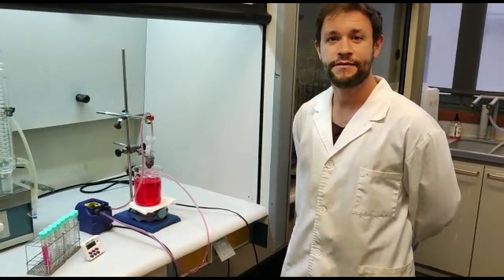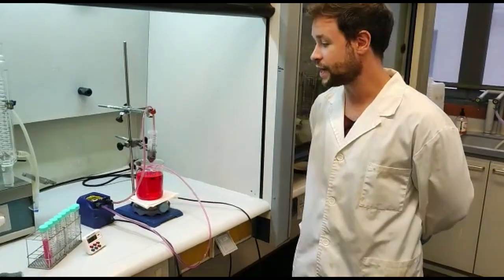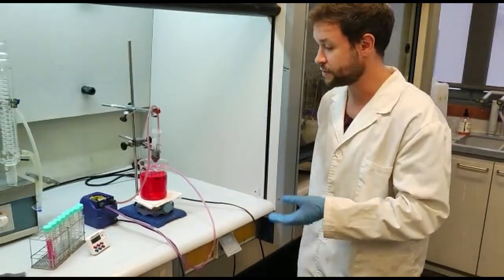Today we are going to make a very simple experiment consisting of a redox reaction of a model pollutant. In this case, a red-colored dye.